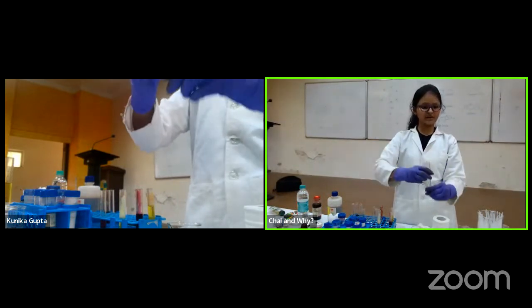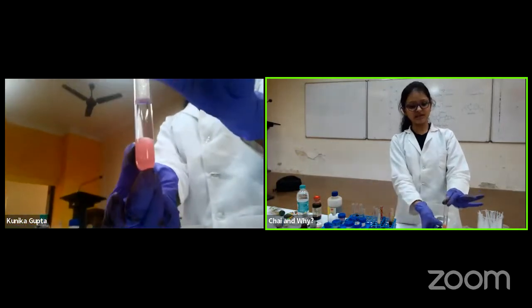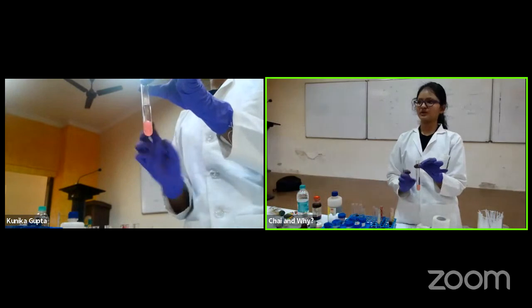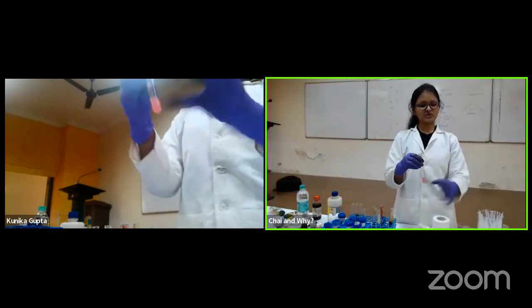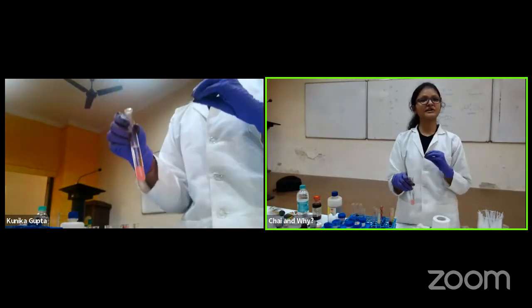So you can control it. Okay. So now if I open that tap, this layer will be separated from the other one. So here I am showing you that in a test tube, just to show you the proof of concept. So this is the first level of purification. Now I have my organic layer. I evaporate it off and I get a concentrated product.